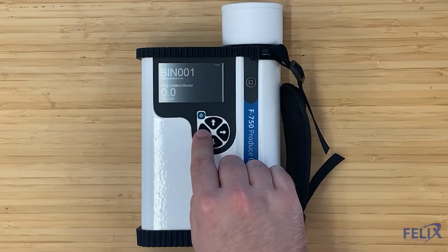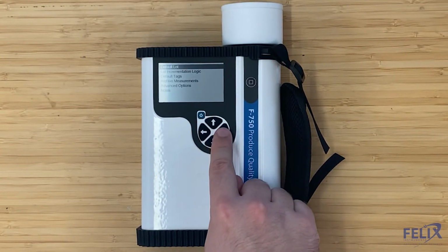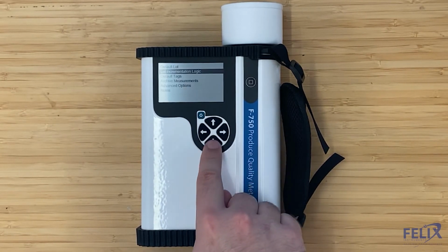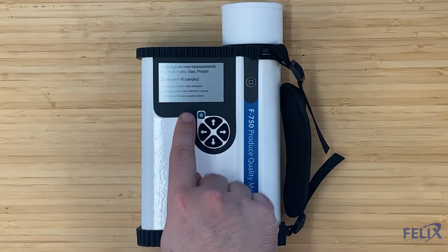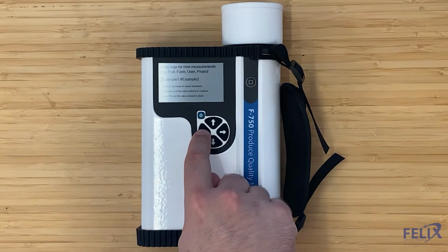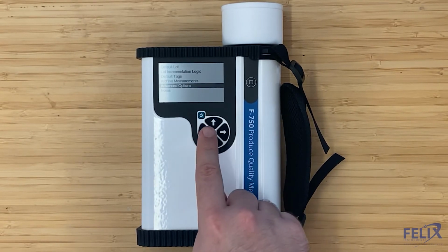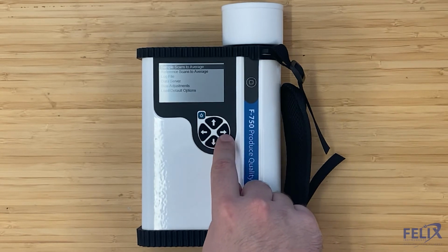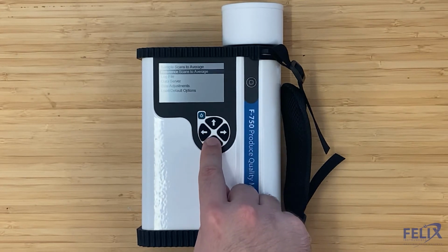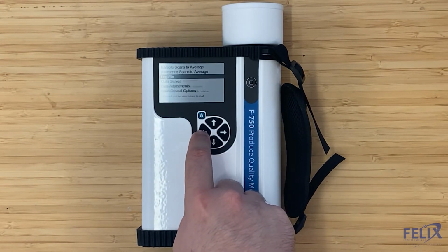Navigating back to the main menu. So from here, what you would want to look at are things like the default lot. Make sure things are named appropriately. You can change your lot incrementation logic, and then this feature is really important for tagging data with any sort of metadata you might have, temperatures, cultivars. The default tags is a great option for that. You can also archive your measurements or access any number of advanced options. So you could change your sample scans to average if you wanted to increase that, or decrease it to decrease the scan time. You can also change the text file name, and you can also upload your data to a data server if need be.